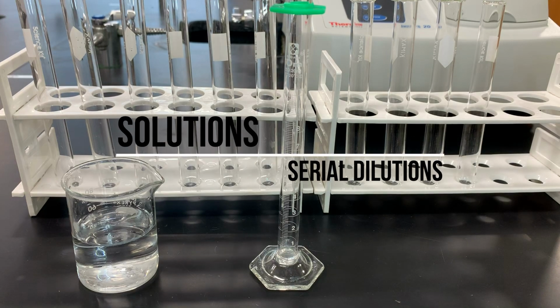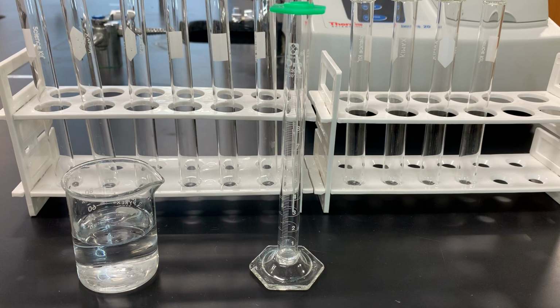In this lab, we will use spectroscopy to determine the concentration of an unknown solution. Before we do that, we need to set up several dilutions of a known concentration. So we're going to take this solution of blue number 1.